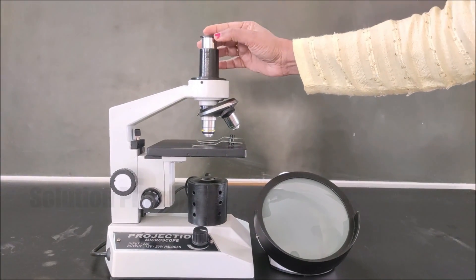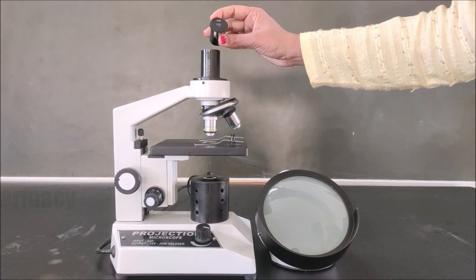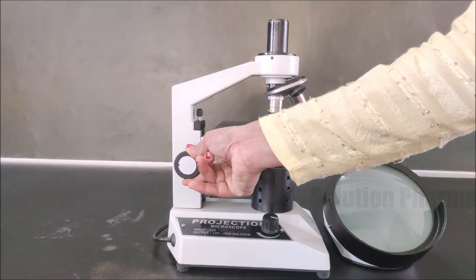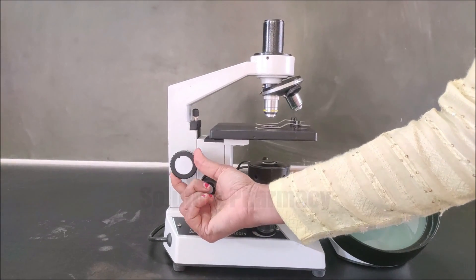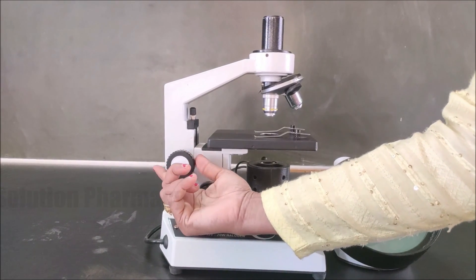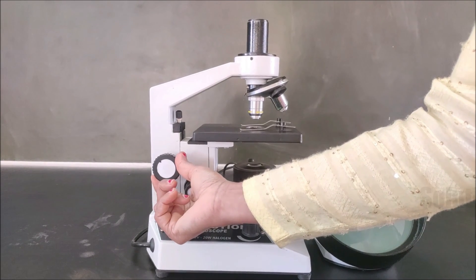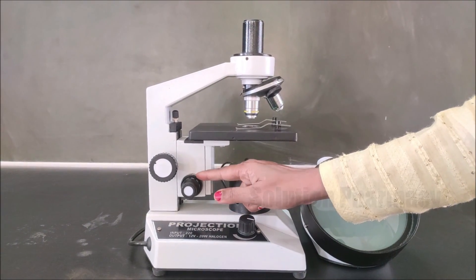This tube is called the eyepiece tube. Here you can see the eyepiece of 10x magnification, which we insert at the top of the microscope inside the eyepiece tube. This knob is called the coarse adjustment knob — we rotate it clockwise and anti-clockwise to properly focus the specimen. During focusing, the stage moves in the downward and upward direction so we move the stage by rotating this knob to properly focus the microscopic object.